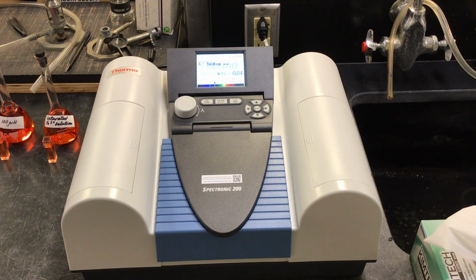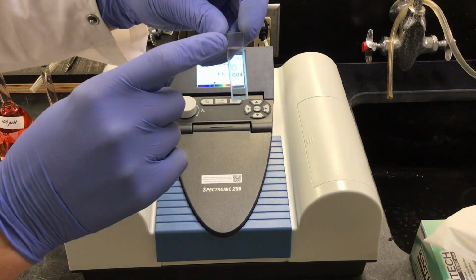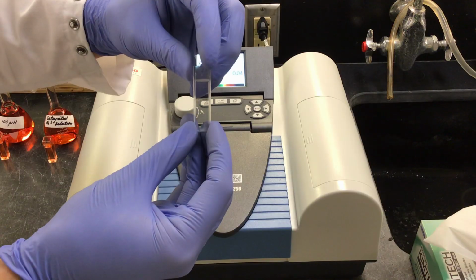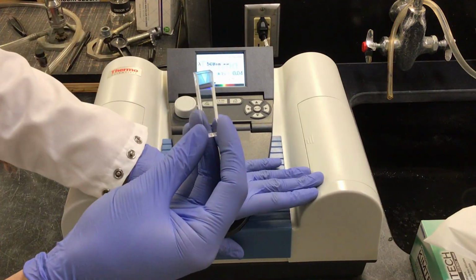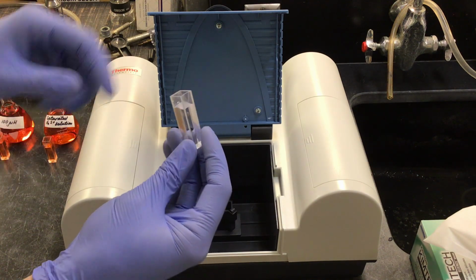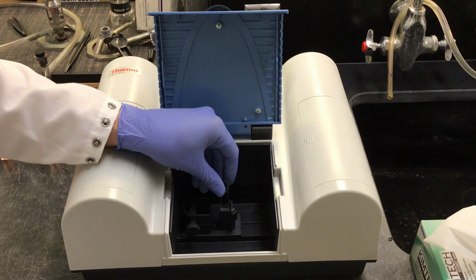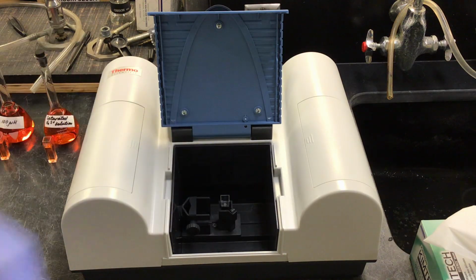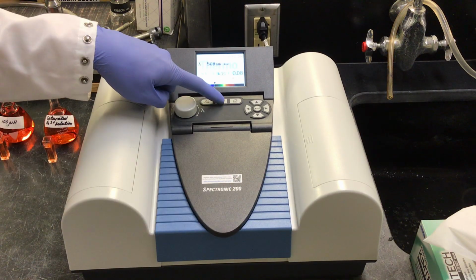Before we do that though, we need to take our cuvette, and you can see on our cuvette we have one side that is frosted with an arrow on it. So we need to take this face and aim it in the appropriate direction. The other faces are all clear. In this case, with our blank, we take the frosted side with the arrow and point it towards our optical lens in here, which will be creating our light. So I have my frosted side facing towards the light of the Spec 200. Now that it is in there, I can close it and press my 0 button.